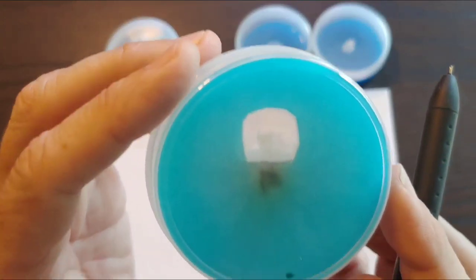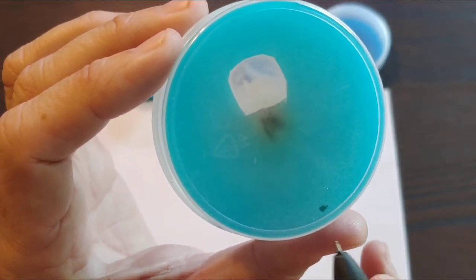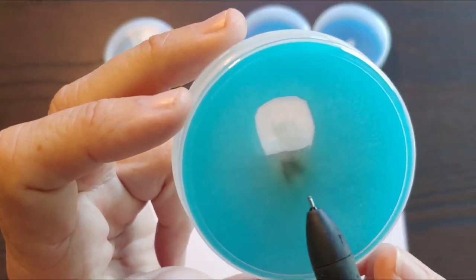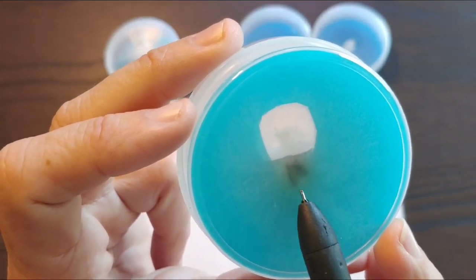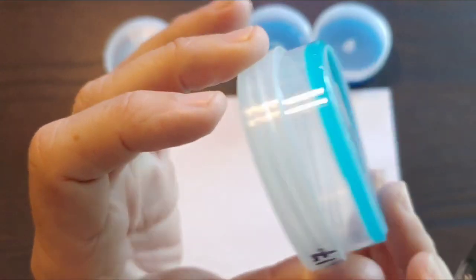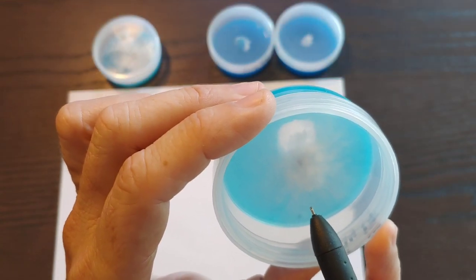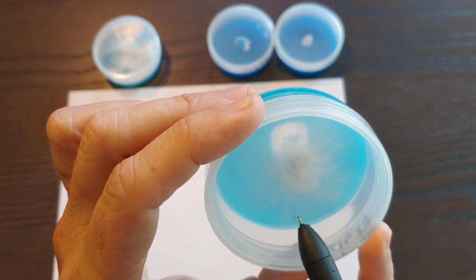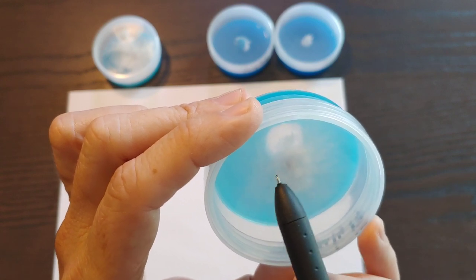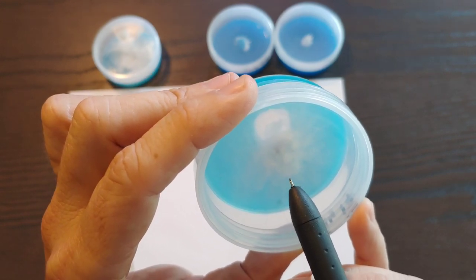It even grew into the hole as I told you guys it would. Look at that. Now this is a piece from the potato flakes that was already there. This is not contamination. I knew that from the get-go, so I didn't worry. From the back you can see the little piece of tissue that we put there, and you can see how it's growing into the hole even. This is strong, good strong mycelium. But since at the time we did it, the mycelium had grown just a little bit and the contamination was very far, I took the chance to cut it out. If the mycelium would have been very close to the contamination, I would not have done that.